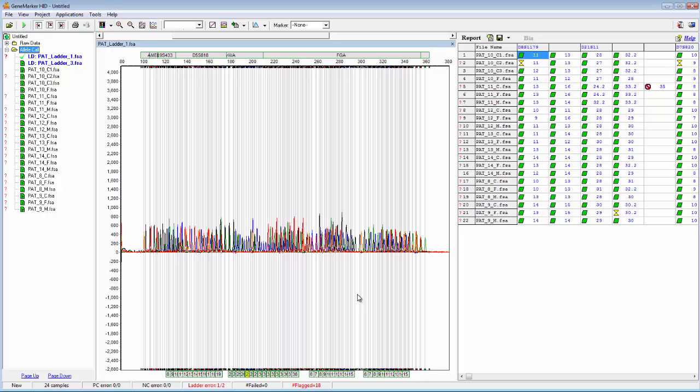So at this point, I've now processed the data. Maybe normally I would go through and look at each sample and review them and look at the allele calls and the size calls and things like that. For now, I'm just going to skip through that and go straight to the Contamination Check tool so I can show that to you. And that's just under Project, Contamination Check.